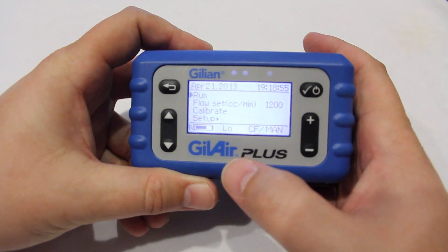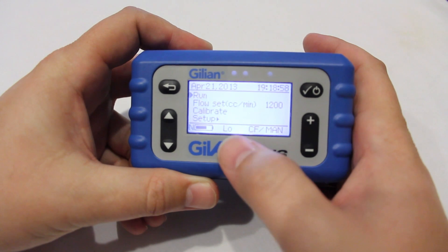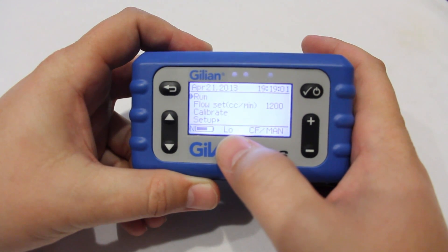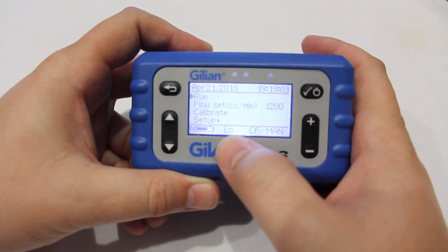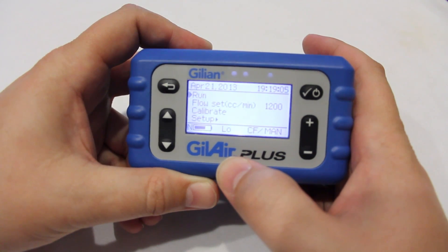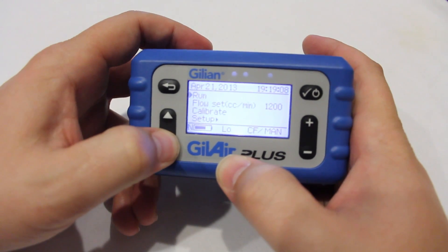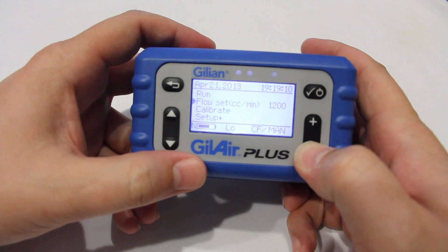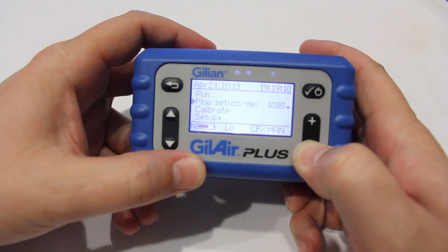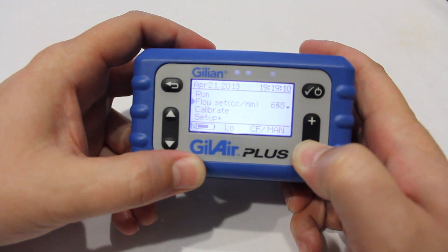High flow is from 450 cc per minute to 5000 cc per minute. Low flow is up to 449 cc per minute. The flow rate must match the mode which the pump is in. If not, an error will display on the screen and you will not be able to start.